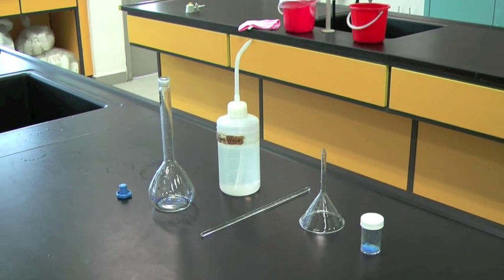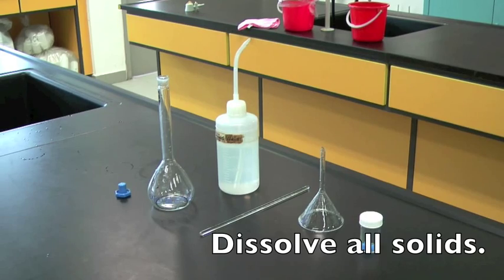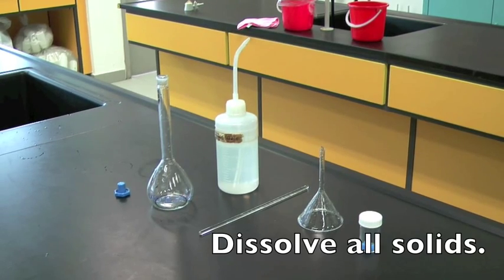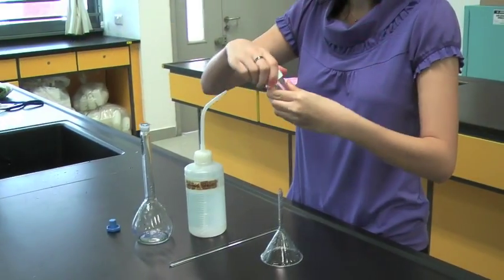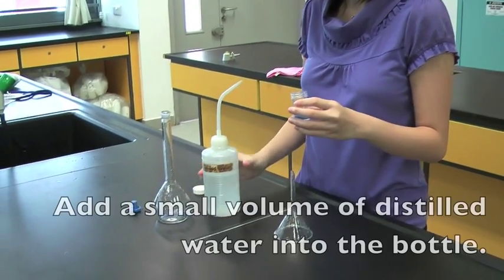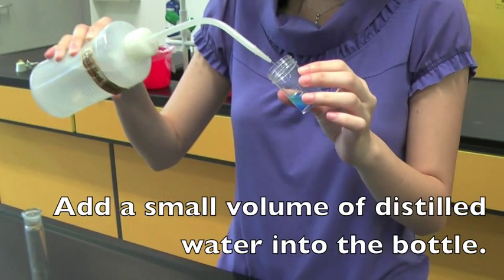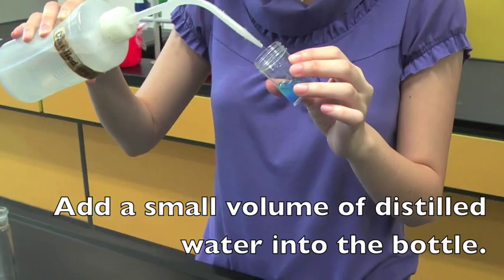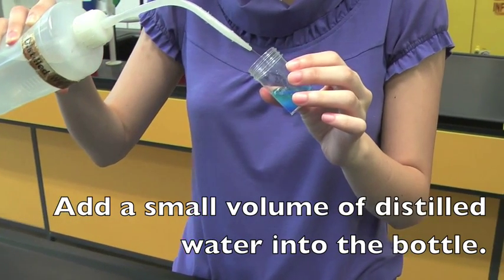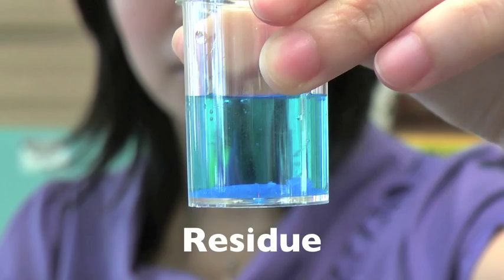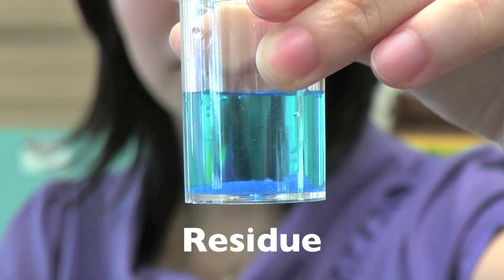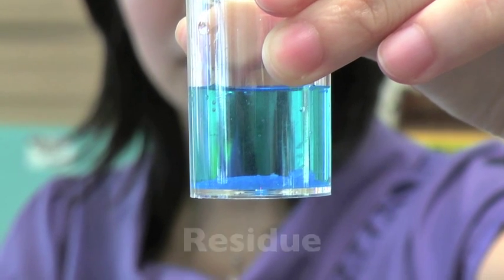In preparing standard solution, it is important to dissolve all solids. First, remove the cap and add a small volume of distilled water into the bottle. The residue in the bottle shows that not all solids are dissolved.